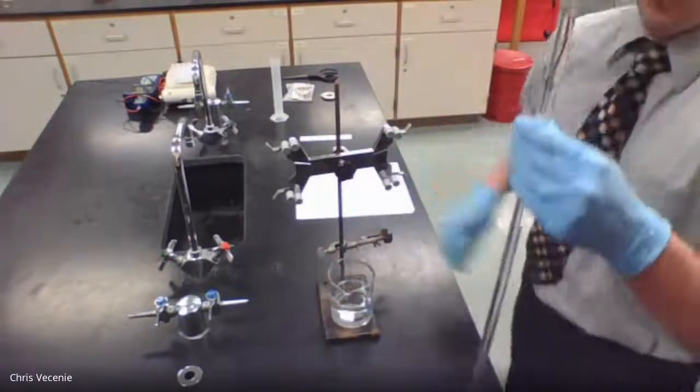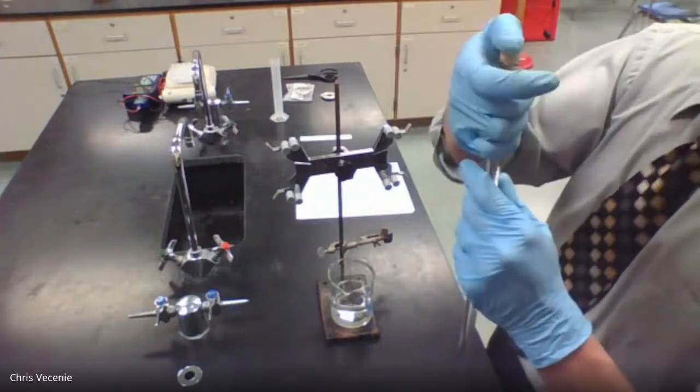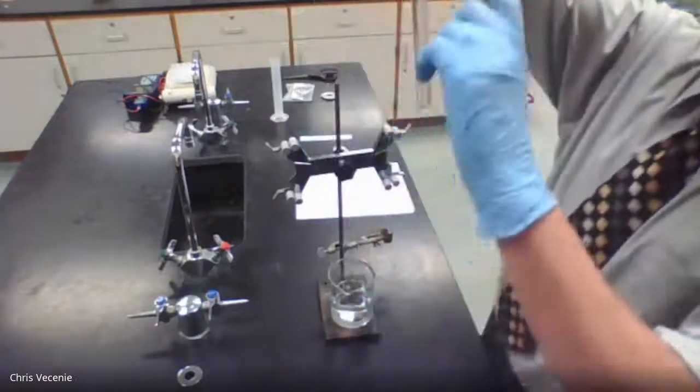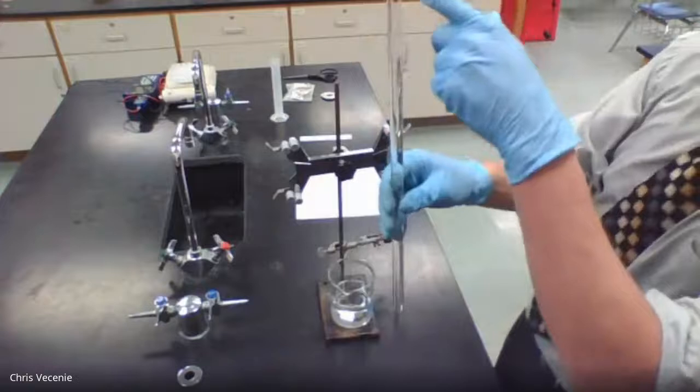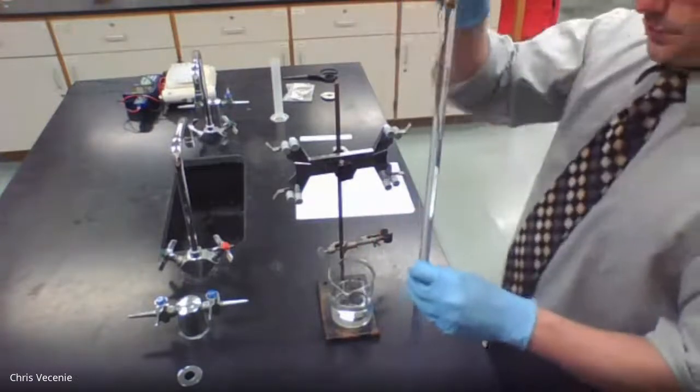And now I'm going to take my cork. I'm going to cap the end of this. All right, and this guy's ready to react. The acid's down here. The metal's up here. So what I'm going to do is I'm going to flip this guy over.